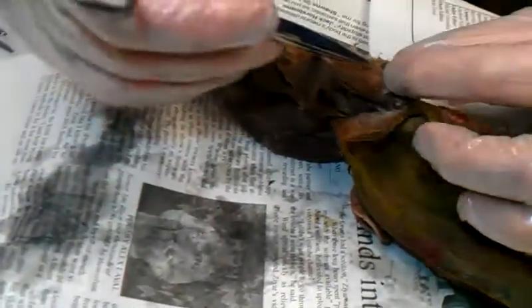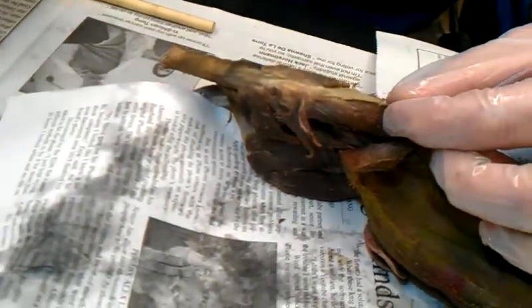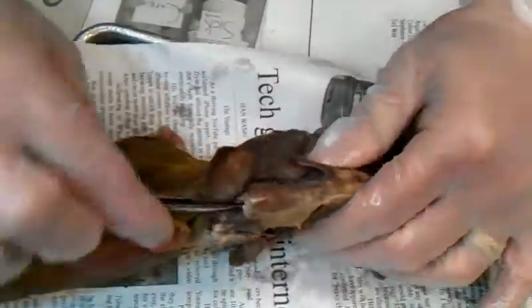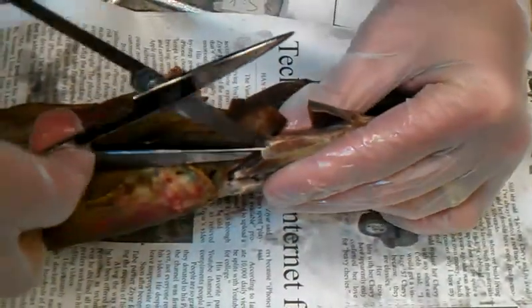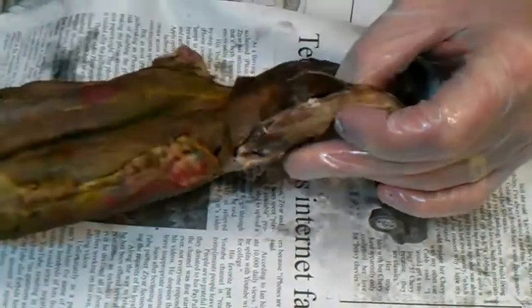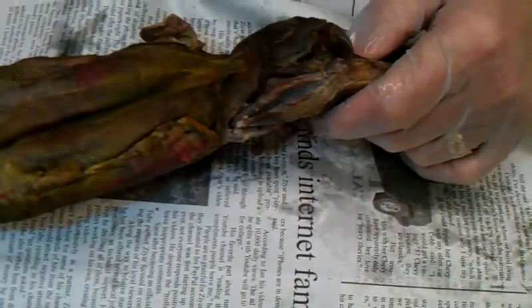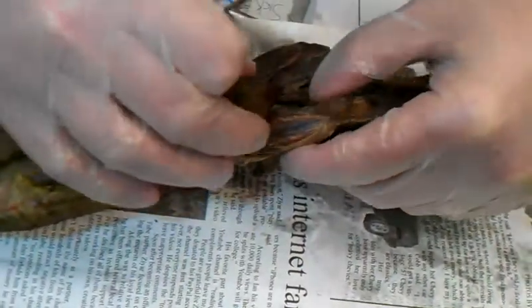So as we break the quads into how many muscles — why is it called a quad? Four. And there's three muscles there; there's got to be another one I'm just not thinking of. This one hasn't been split open yet so I'm going to flip him over. I need to put the scissor edge on that, otherwise it'll tear and look cruddy. And I'm separating the vastus from the rectus femoris. Usually once that starts you can just force your finger into it and it'll separate all the way. So that's separated nicely — you've got the vastus medialis and rectus femoris, vastus lateralis.